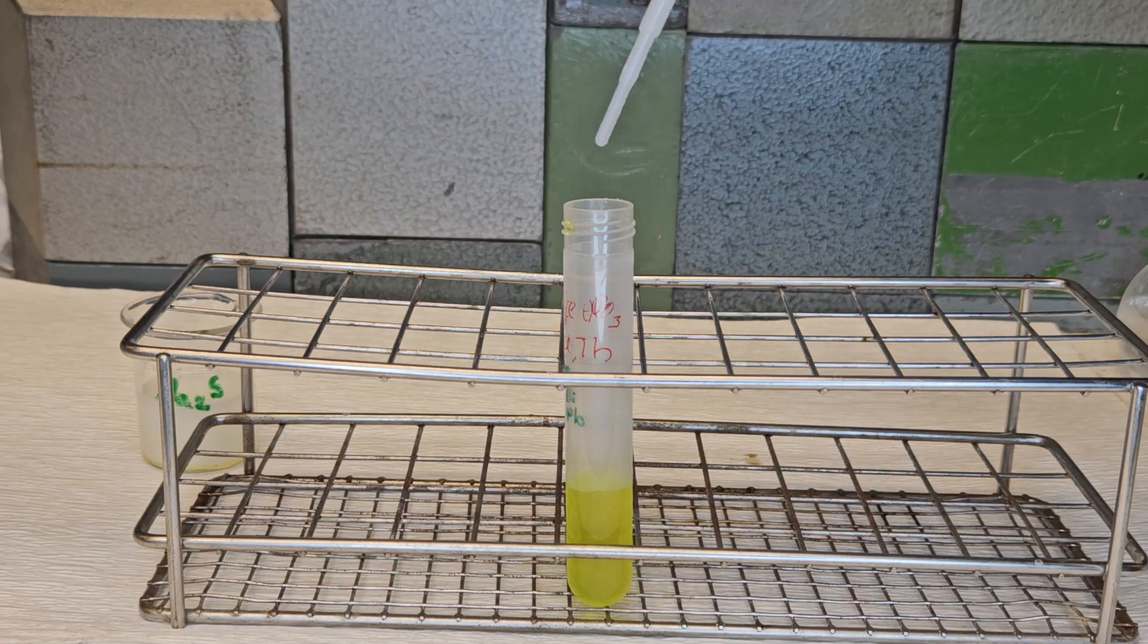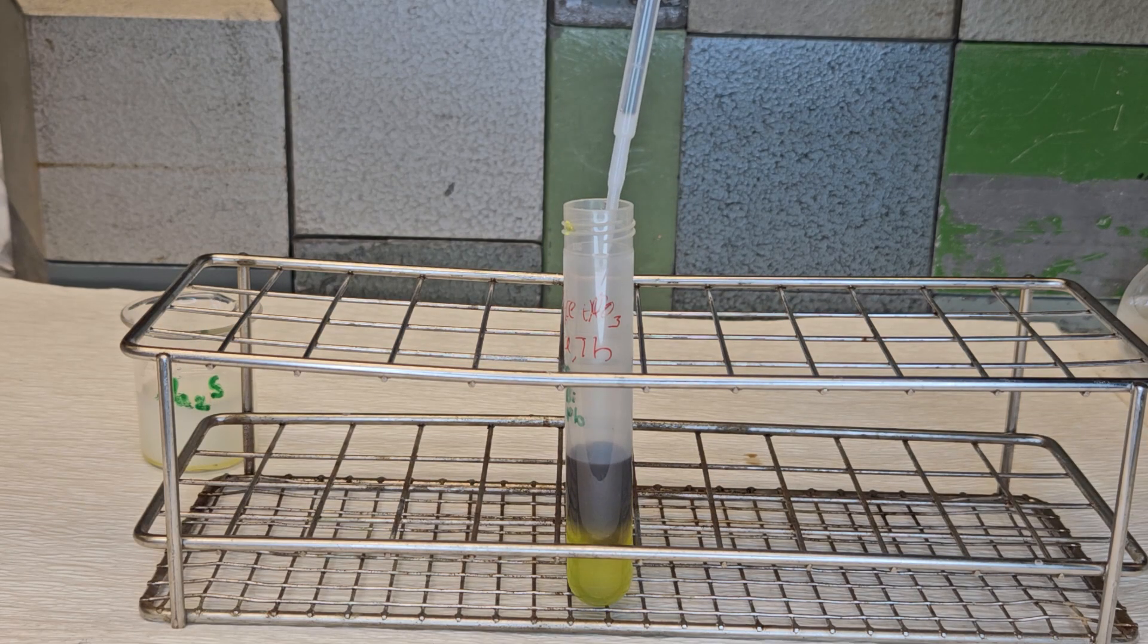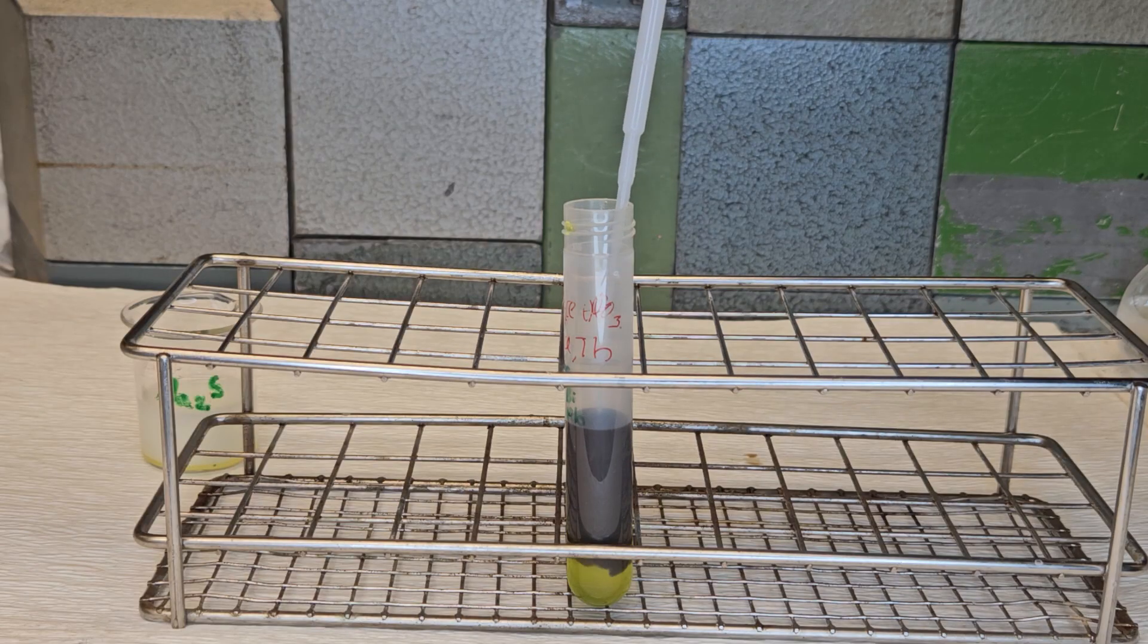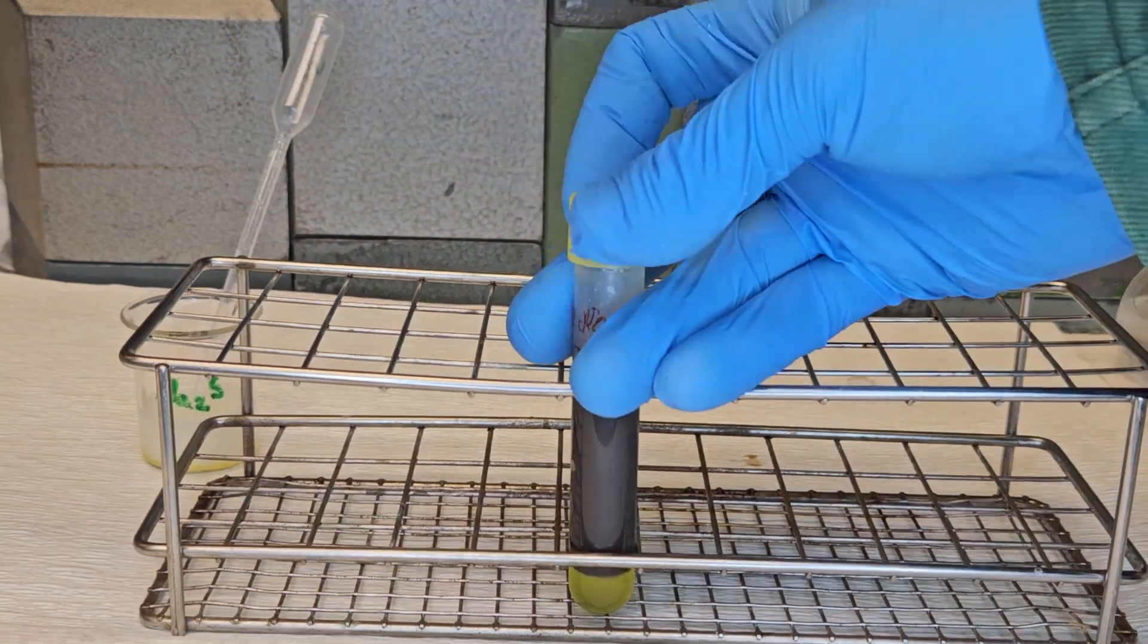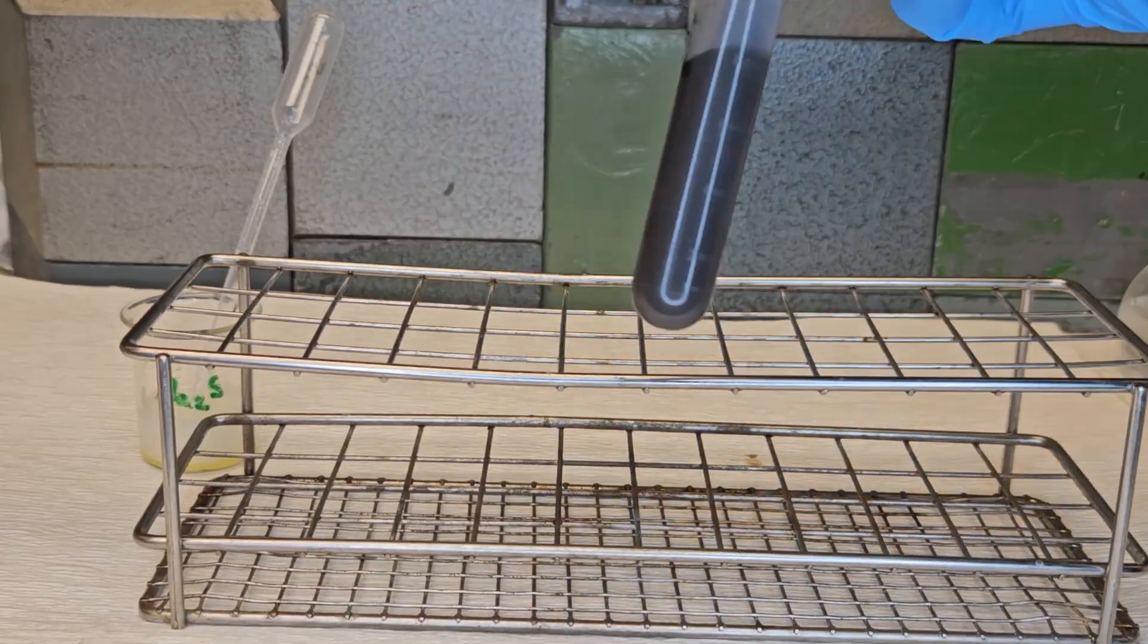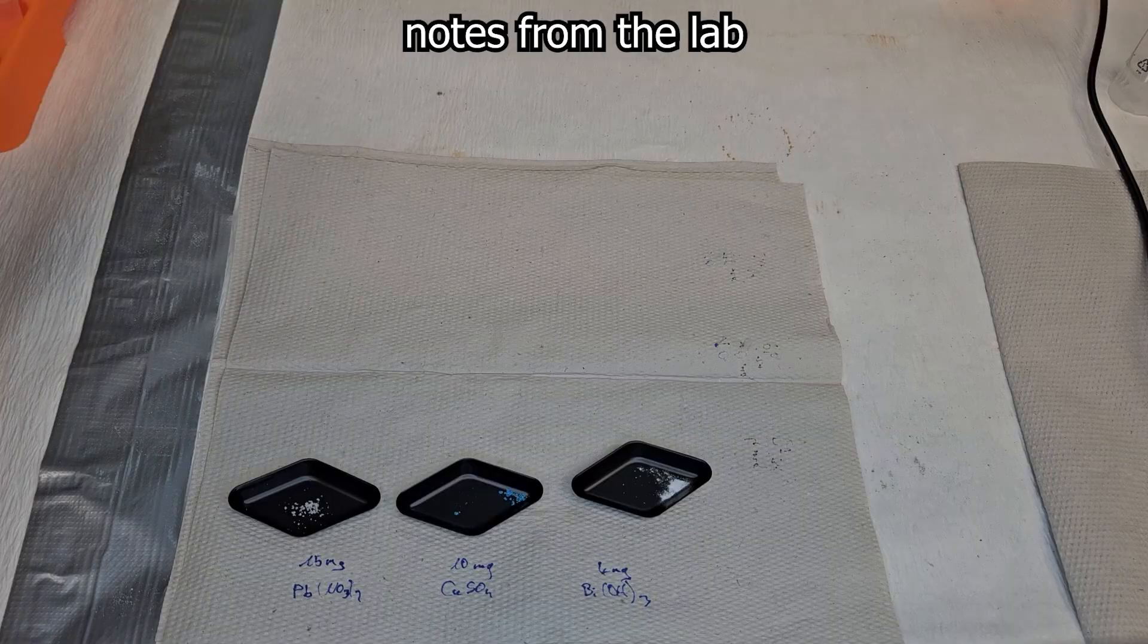Today there are more efficient ways to make polonium available, but that was not the point of this video. I wanted to show you what observations Marie Skłodowska-Curie probably made the first time doing this experiment. The observations were probably even more colorful because she had a lot more material.